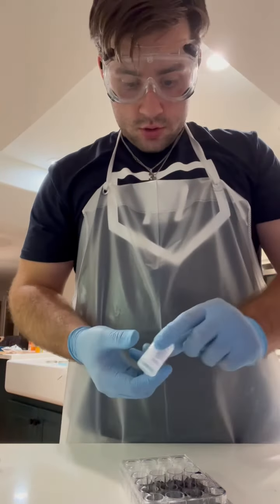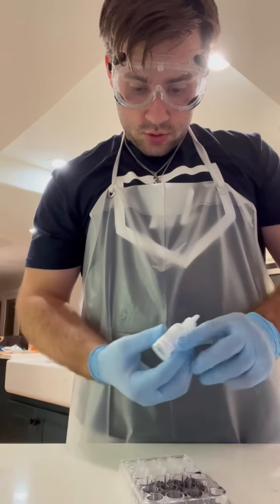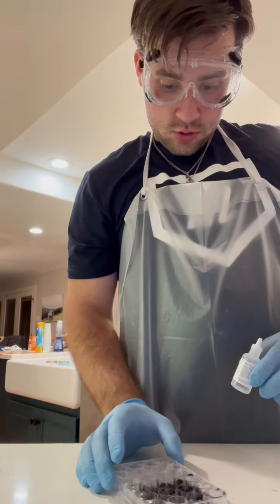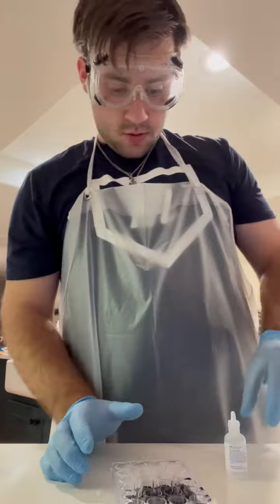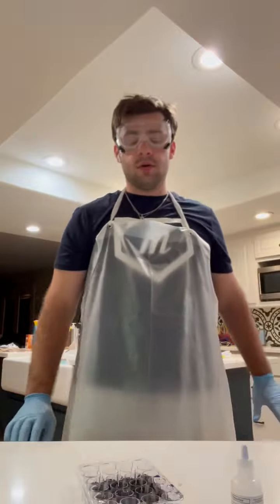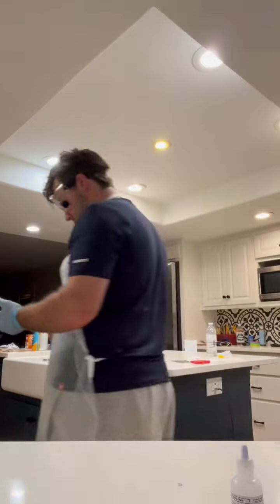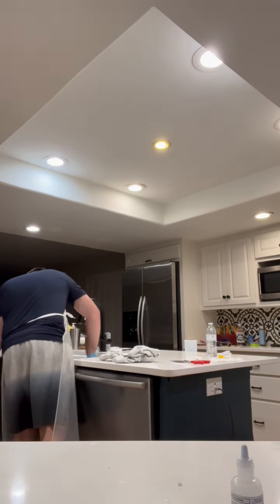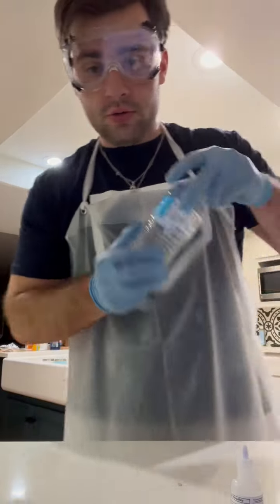After completing the first 2 tables of the procedure, I have run out of room for the 3rd one, so I need to dump and rinse with purified bottled water.